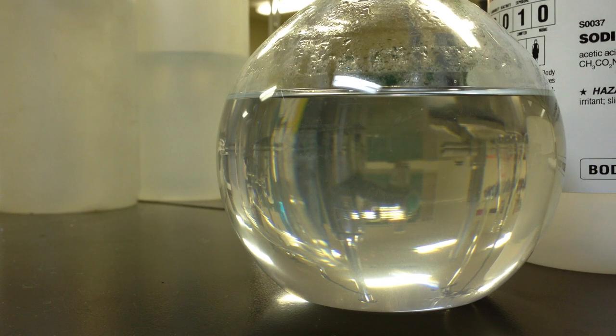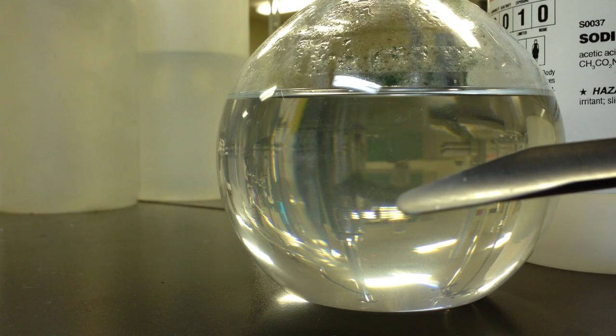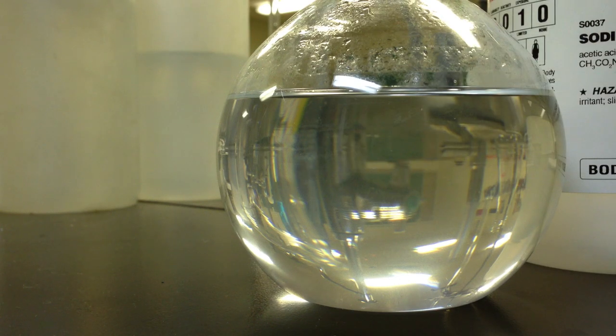Okay, just really quick, I'm going to add one tiny seed crystal. I'm not sure if you can see on the tip of that spatula there. Right at the tip, we're going to add that to my supersaturated solution of sodium acetate.